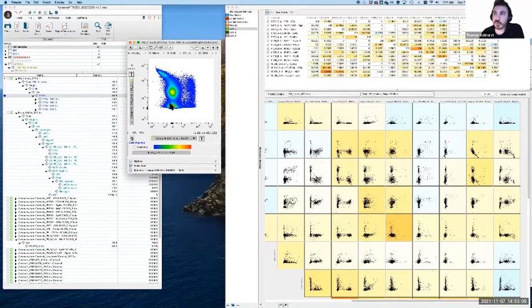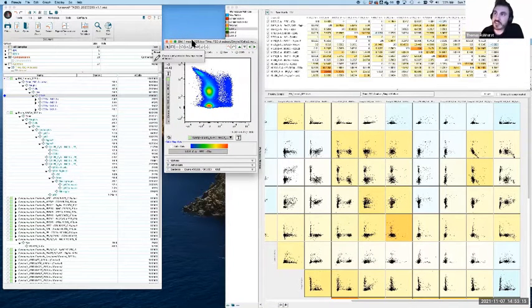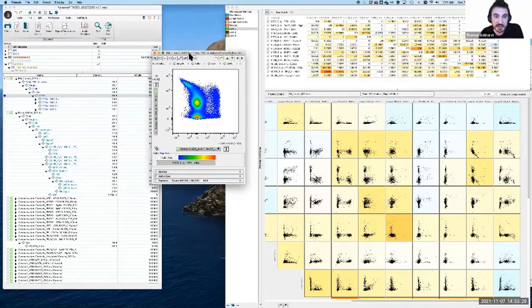So this looks like overcompensation. Now, what I'm going to do here to do this in a way that is robust is I'm not going to just start freewheeling, changing the values here. I'm going to bring up a few of my controls and use that to inform me what's going on. Now, the 2 main ones that I need in this case to really help me are a single stain and my FMO, or FMOs.